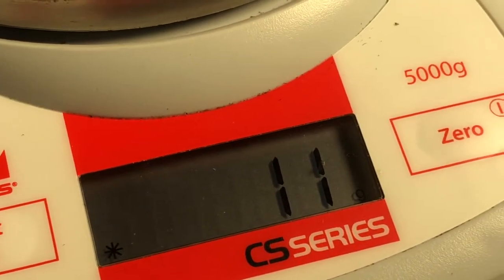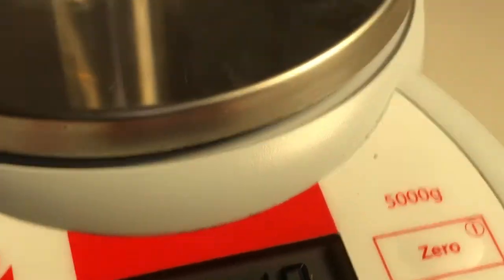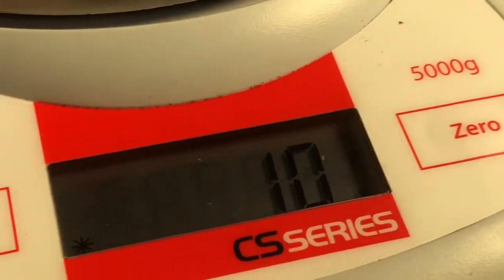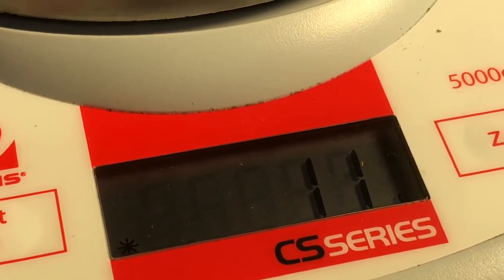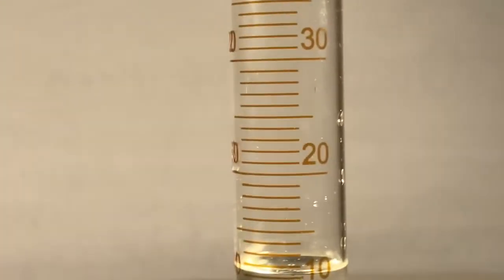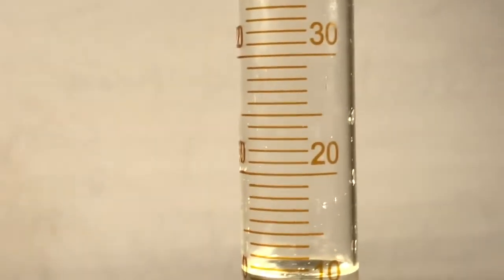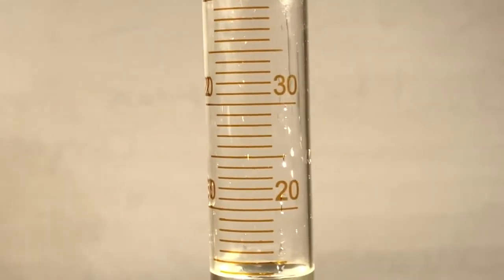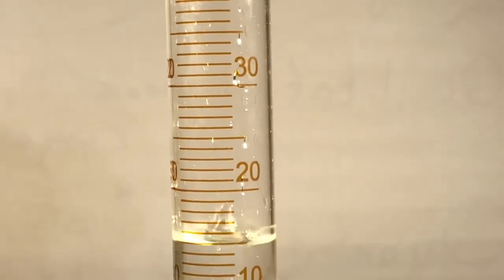Oh, that's in grams, ladies and gentlemen, that's in grams. Which one are you gonna take? It changed on us. That ain't right, but we'll take it. All right, here I come. I'm gonna splash some down in there now. Here it comes. A couple of good squirts. Here's your second data point.